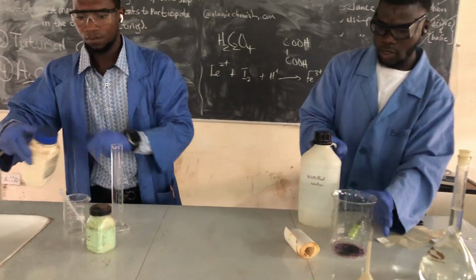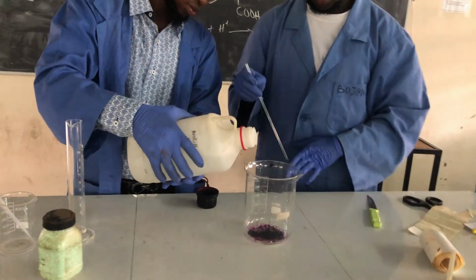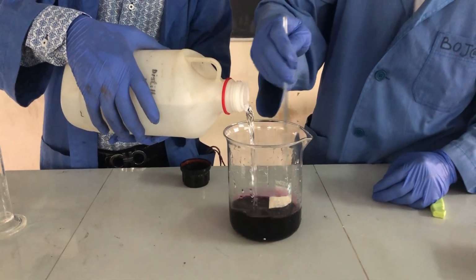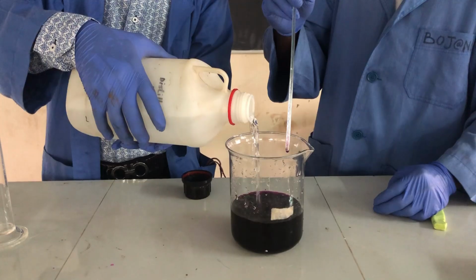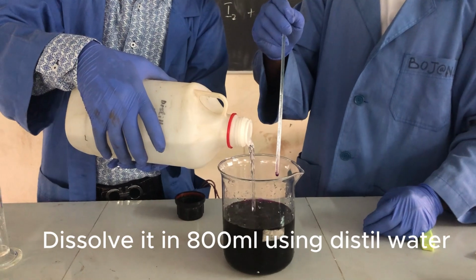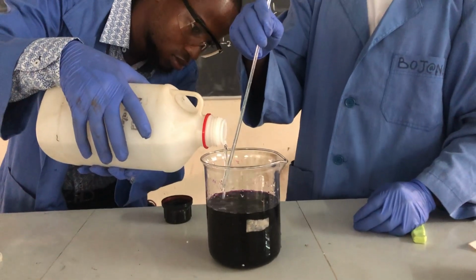So we are going to dissolve in 800. We are starting it.